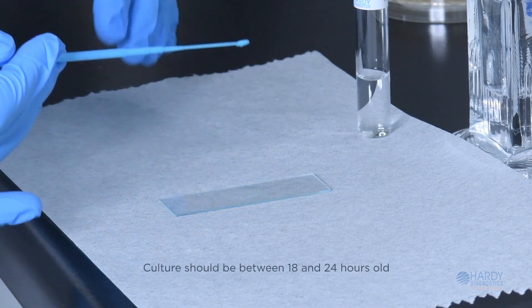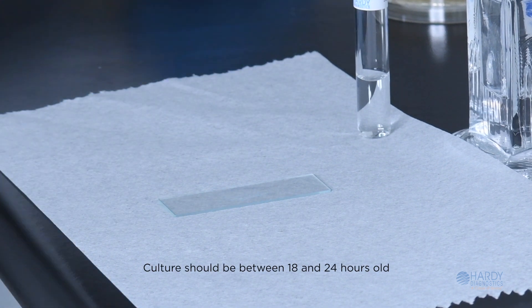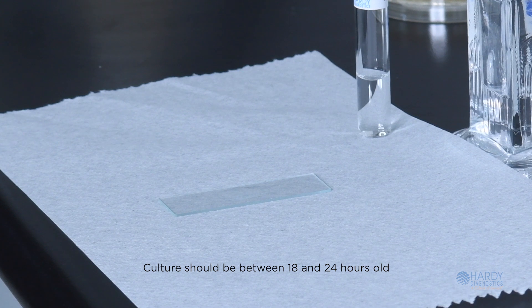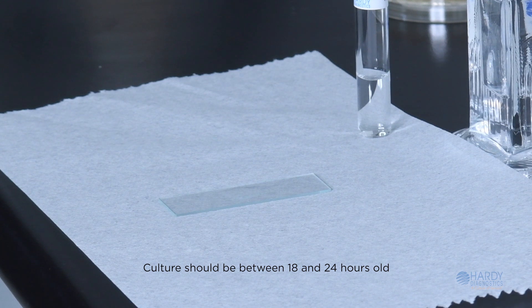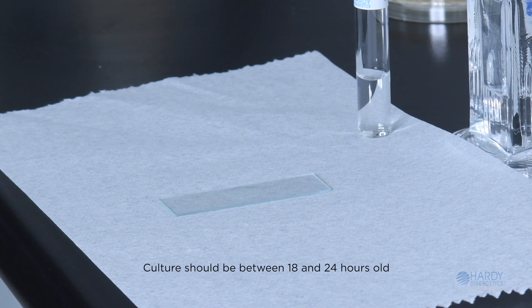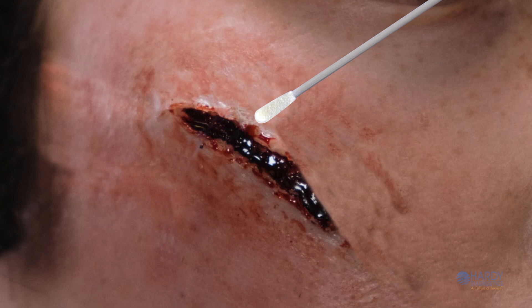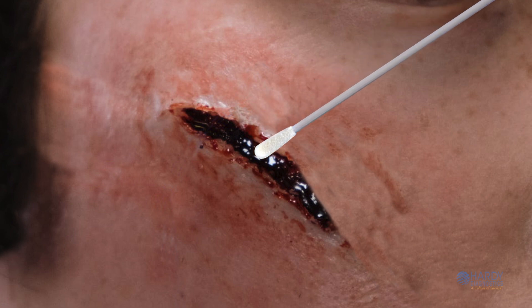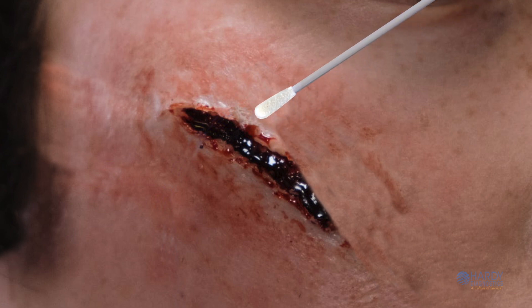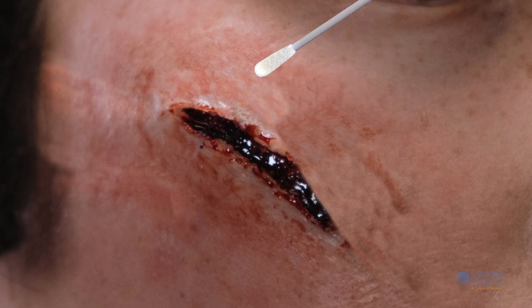Ideally, the culture should be between 18 and 24 hours old, because older cells may show variable results. Alternatively, you can use a collection swab from a clinical specimen or environmental sample.